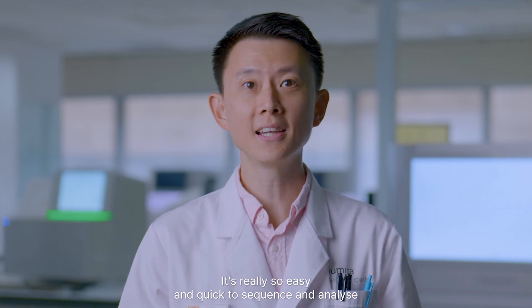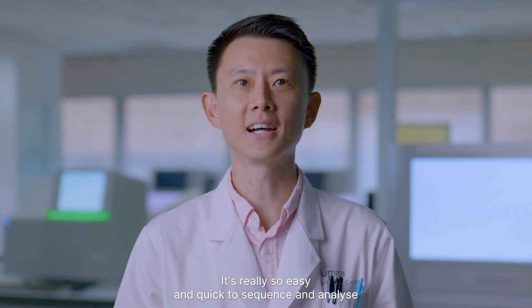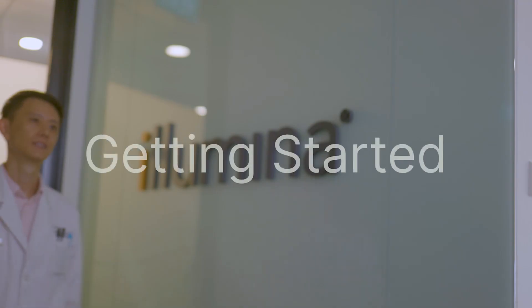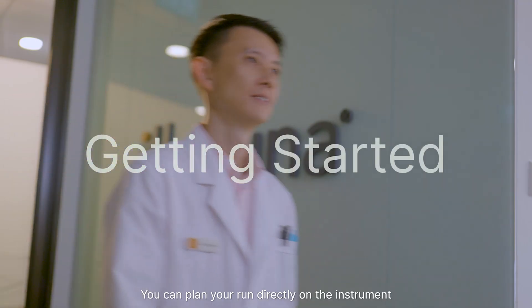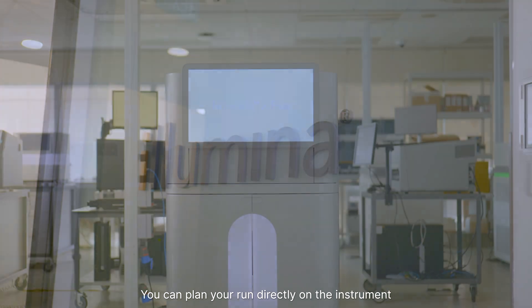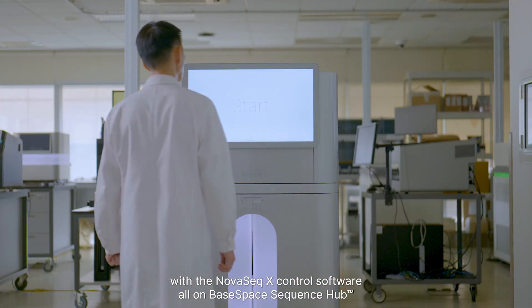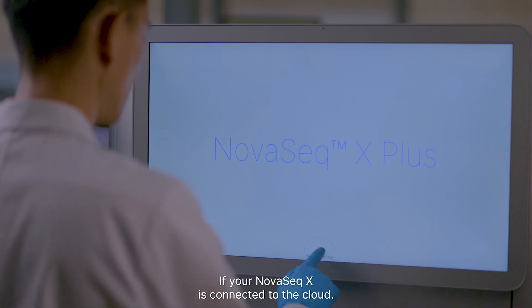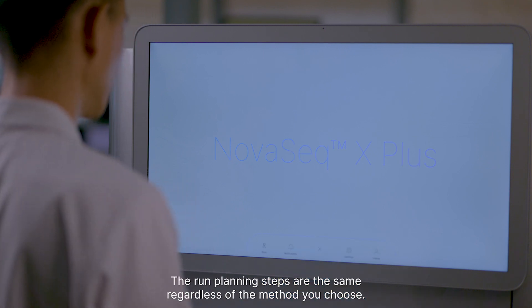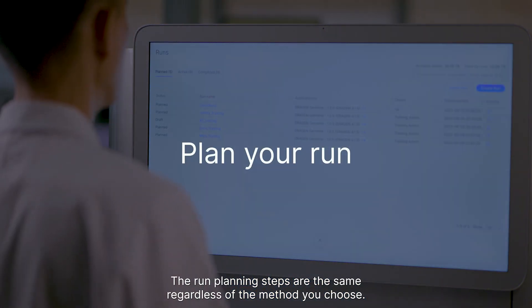It's really so easy and quick to sequence and analyse whole human genomes at scale nowadays. You can plan your run directly on the instrument with the NovaSeq X control software, or on BaseSpace Sequence Hub if your NovaSeq X is connected to the cloud. The run planning steps are the same regardless of the method you choose.